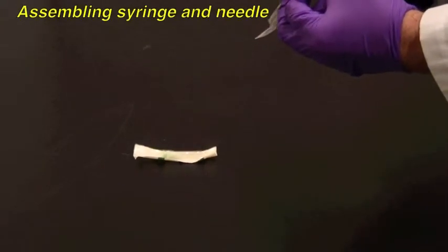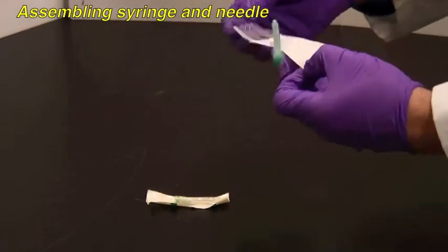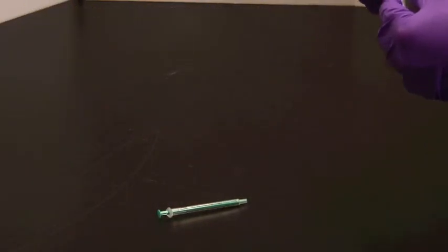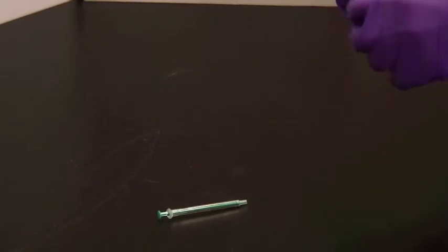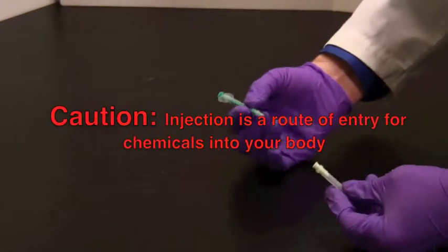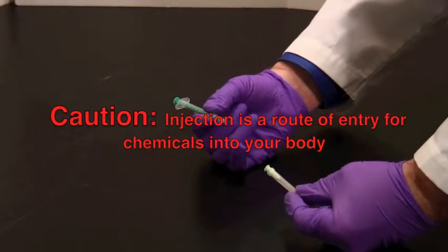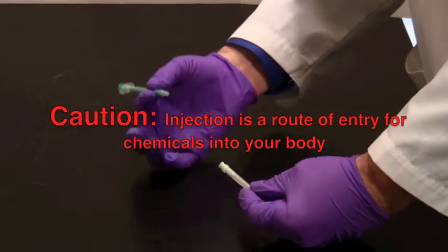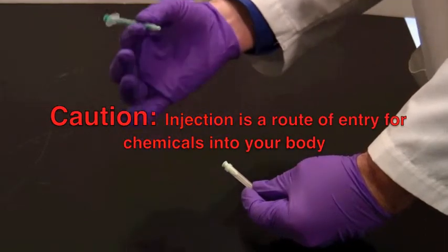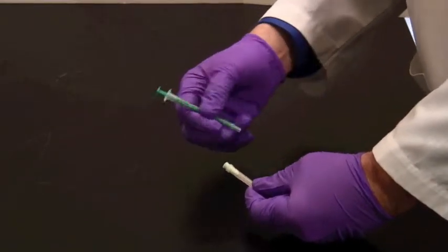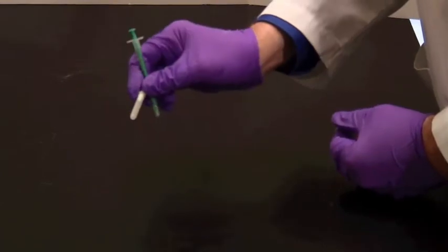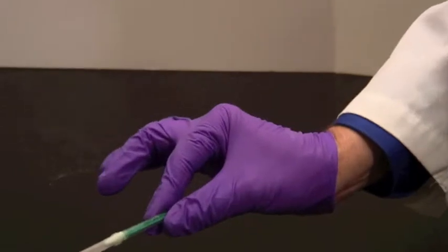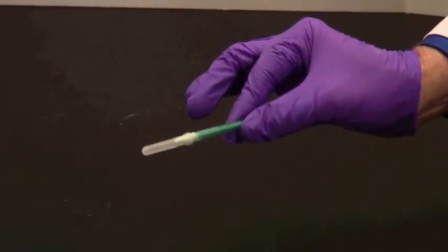Your TA will have given you a syringe, so you can pop it out of the container like that, and also a needle. You need to be really careful with needles and syringes. Hospitals use them to get chemicals inside people all the time. They are a super route of entry. So please be very careful how you actually handle them. The needle actually comes inside a hard plastic case, and it's a friction-fit onto the end of the syringe like this.